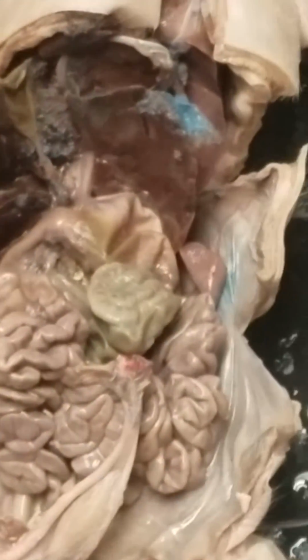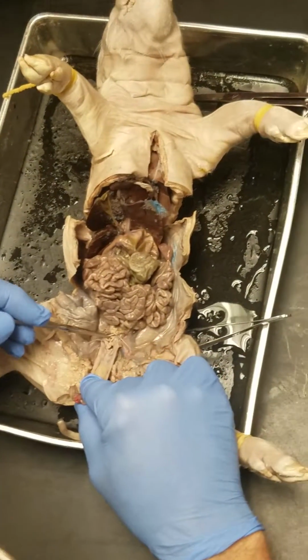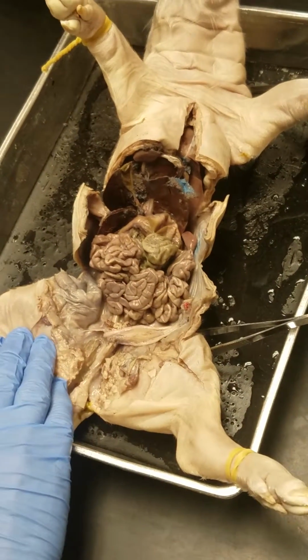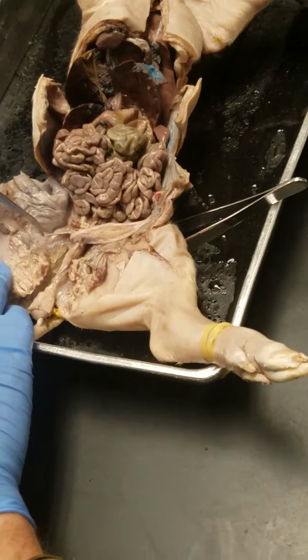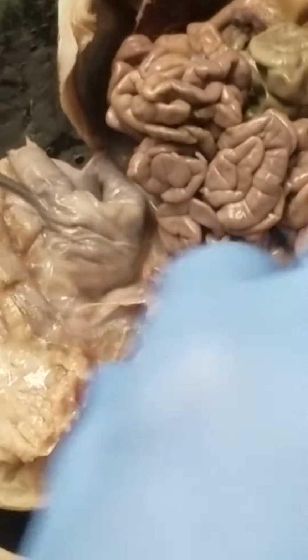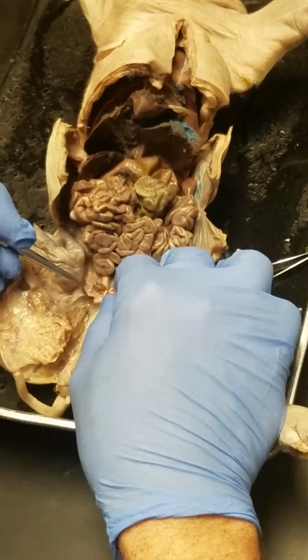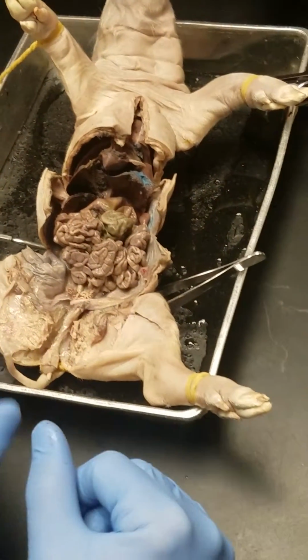Thank you. And that's it. Most of the other stuff you guys are good. Obviously, you can't find the inguinal canal on this one. You have to find a boy for an inguinal canal. But if we were going to pretend, don't you say I told you a girl has an inguinal canal. But this ligament going this way, that's what an inguinal canal looks like on the male. That's not an inguinal canal, but it kind of looks that way. You'll just see the gonadal artery and the vas deferens just diving into a pocket of tissue.